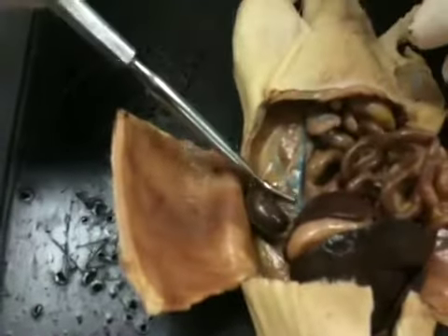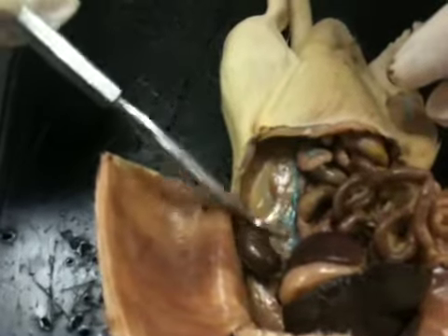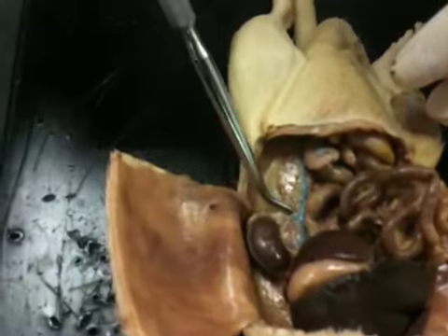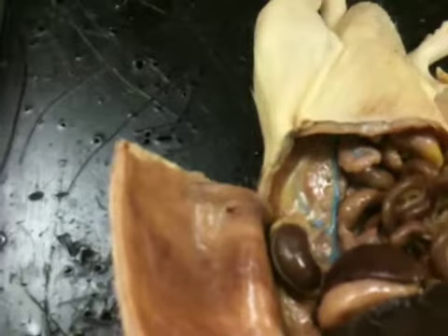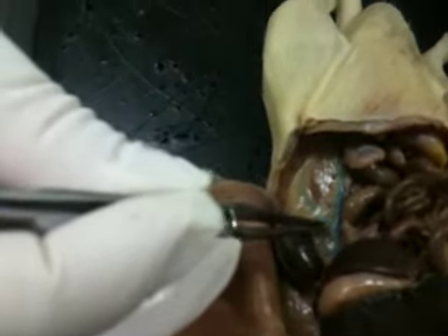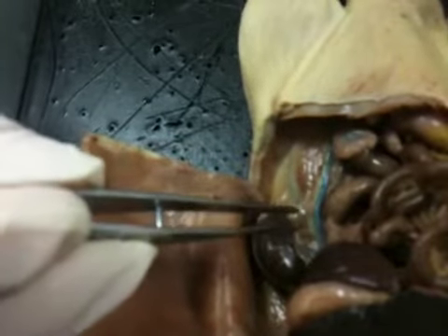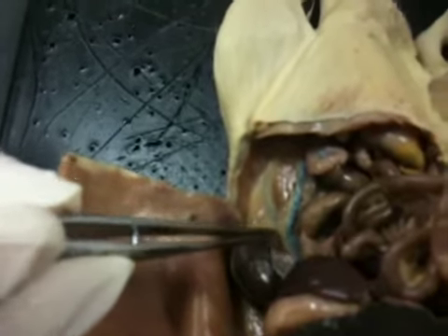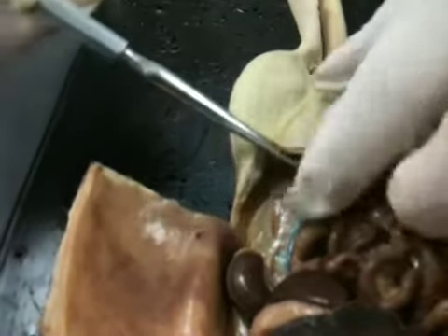Then we need to find the ureter. So the best way to do that is to use a probe or your forceps and kind of push down on the tissue, and you will see a very faint flesh-colored ribbon, and that is the ureter. So very fragile. It's usually embedded in some mesentery, and you can see that as I'm picking that up right there. It's a flesh-colored ribbon, and we can follow that all the way down to the bladder.